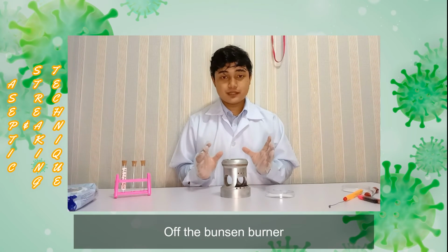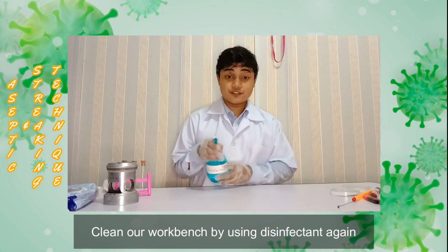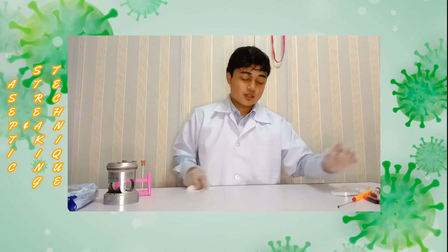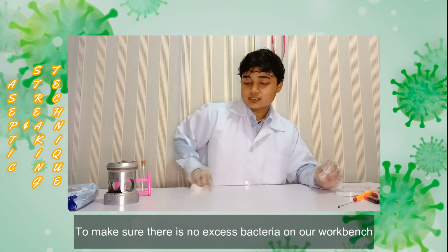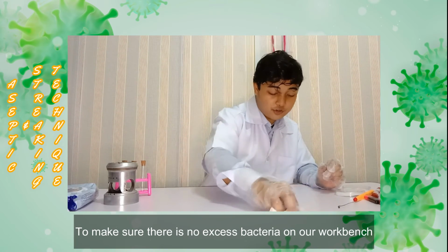So after we finish all this procedure, we need to turn off the Bunsen burner. Then we clean our workbench with disinfectant again. Then use a tissue to wipe our workbench. This is very important because we want to make sure there are no excess microorganisms that we used in our experiments on our workbench.